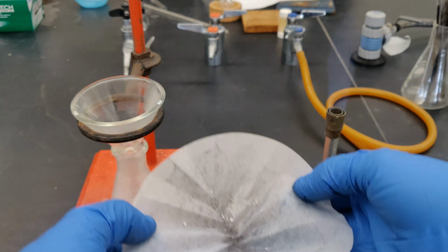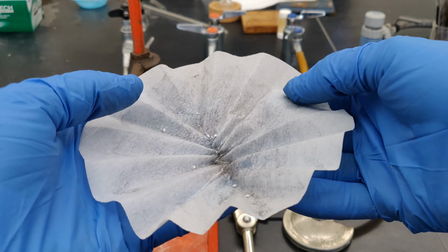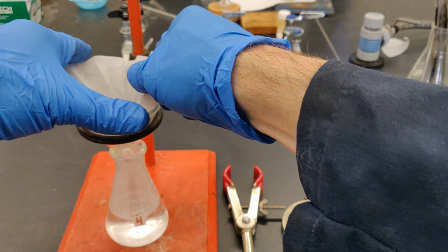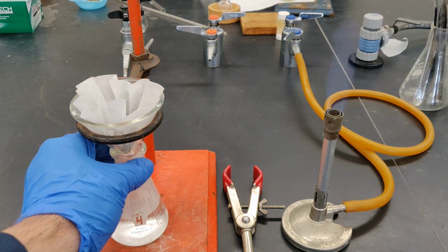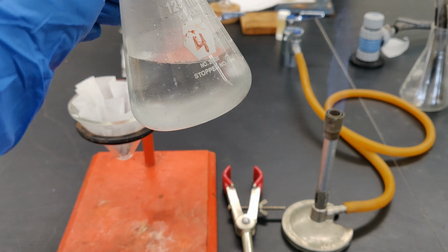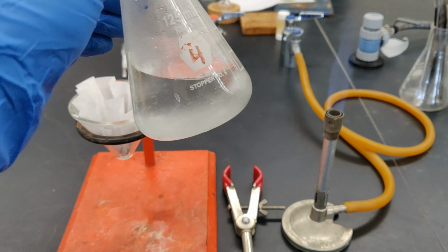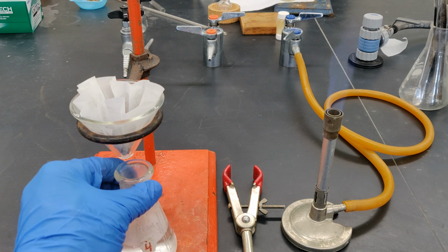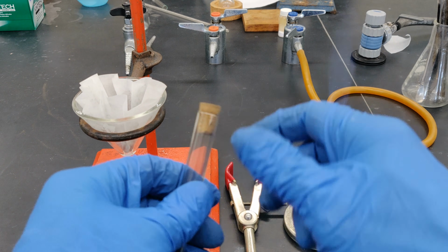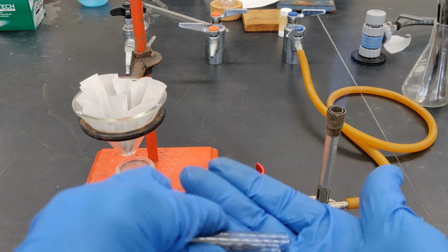If filtration was performed correctly, the filter paper should contain charcoal and sand with possibly only a very small amount of white solid or shiny crystals on its surface. The filtered solution will most likely contain solid cinnamic acid product that precipitated when the hot solution cooled rapidly upon contact with the cool glass of the receiving vessel. You need to redissolve it and allow it to recrystallize slowly so that you can obtain a pure product.